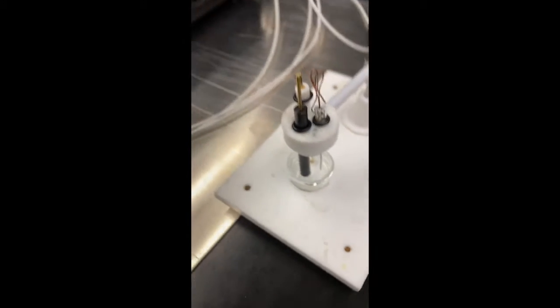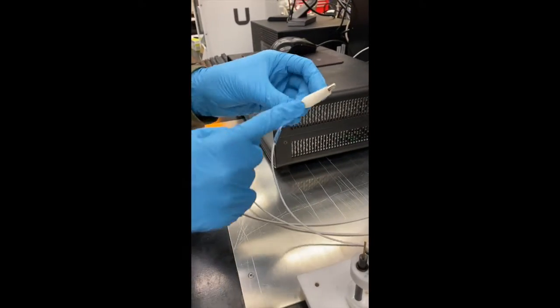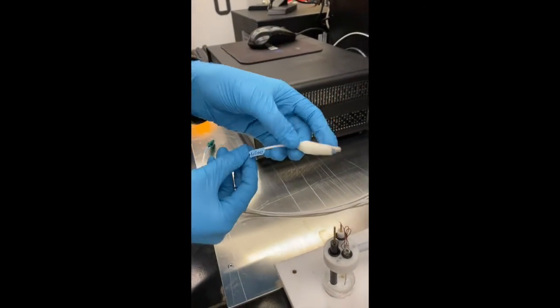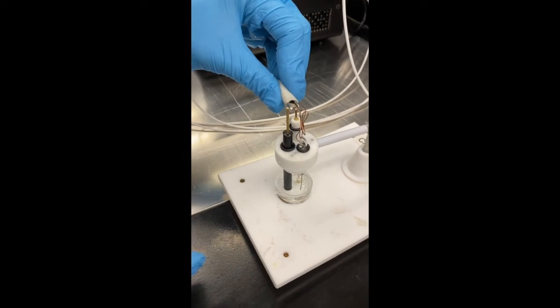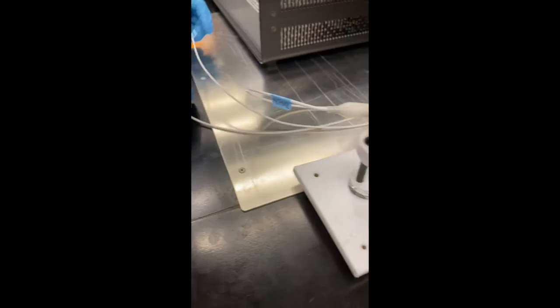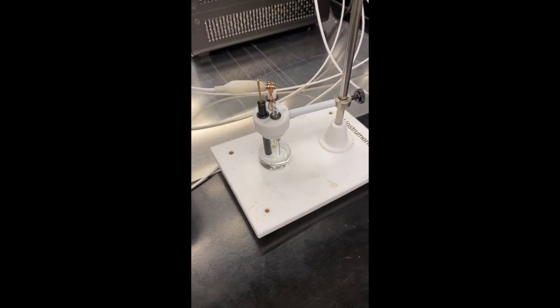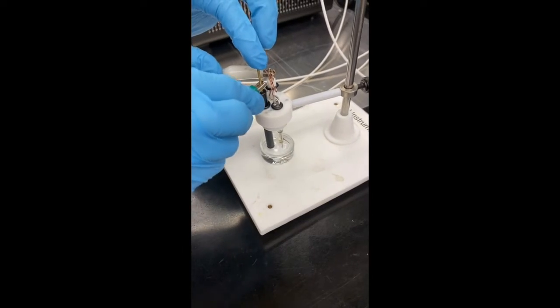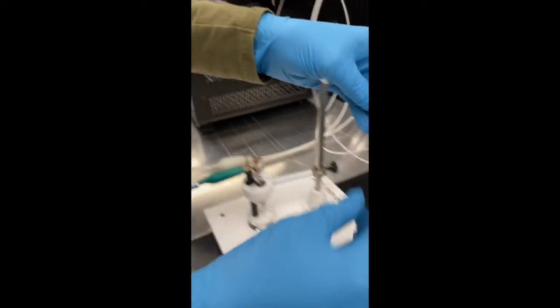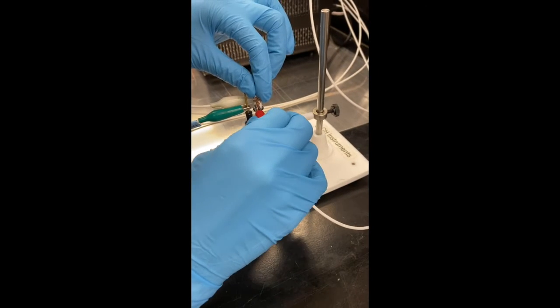Great. So now we're going to connect the electrodes. So we're going to start with the white here. This is for the reference electrode. So I'm going to connect that here, like this. Then I'm going to take the working electrode, which is the green, and attach that to the working electrode. And finally, we have the counter electrode here, which is red. And we're going to connect this last.